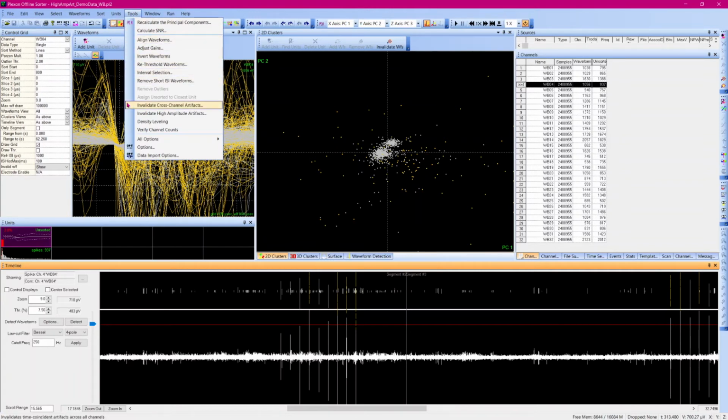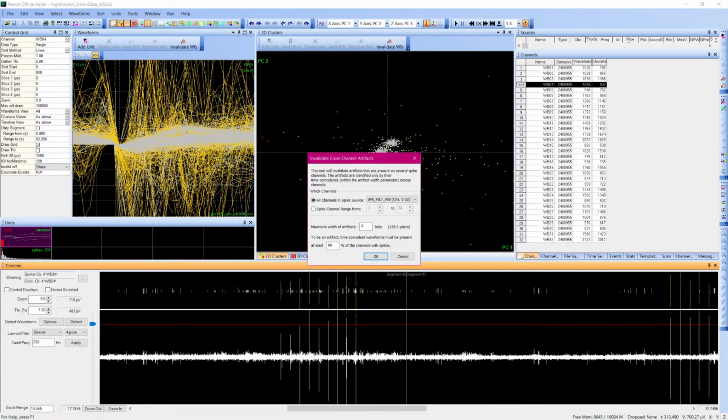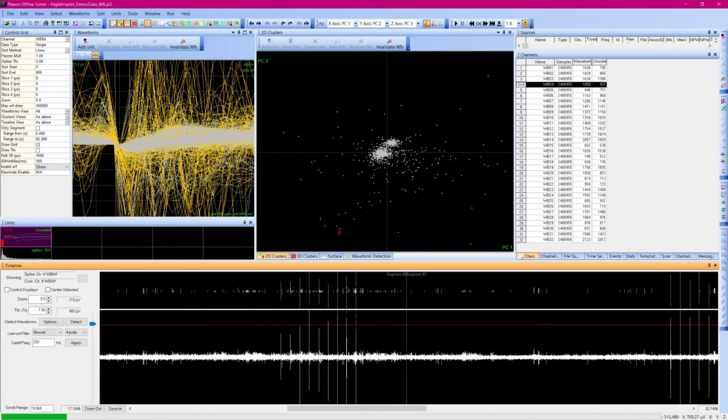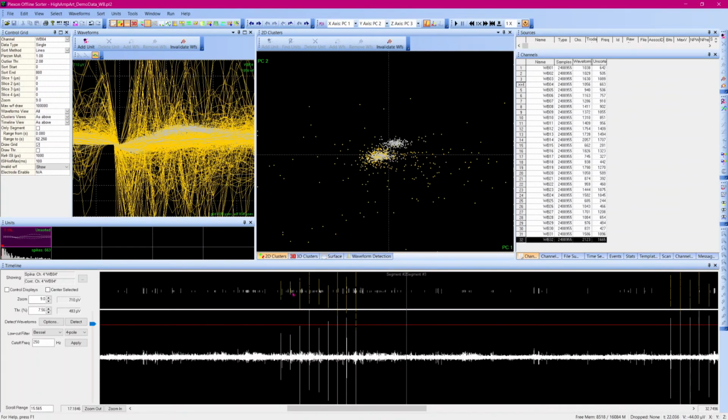As the name suggests, for this tool you must apply it across multiple channels. In these data, we are looking for artifacts that are entire waveforms, which means the artifact can be up to 800 microseconds or 32 ADC ticks. The percent of channels that must have an artifact is how you control the restrictiveness of this tool. Whatever setting you choose will ultimately depend on your data and how prevalent the artifact is across channels. Since I've already removed many of these artifacts, I'll do a moderate setting of 50%. That means out of 32 channels, the waveform must occur at the exact same time in at least 16 of them to be classified as an artifact. As a caution, this tool can be very slow if it finds a lot of artifact waveforms. Now, you can see that the artifacts that were not removed by Invalidate High Amplitude tool were removed with the Cross Channels tool.